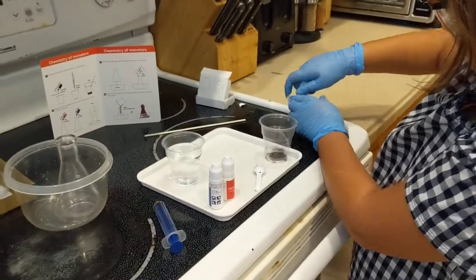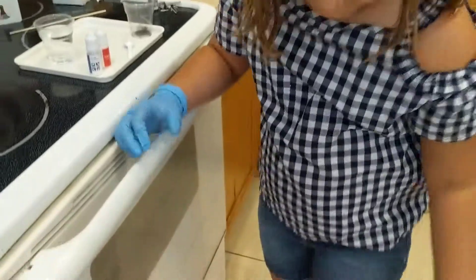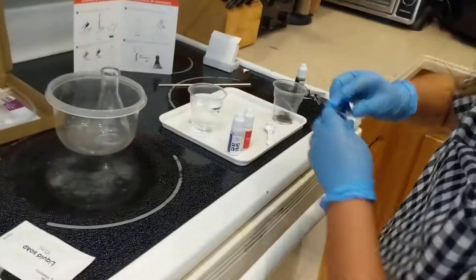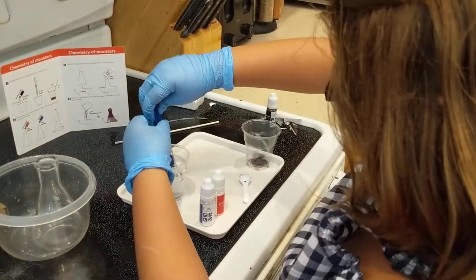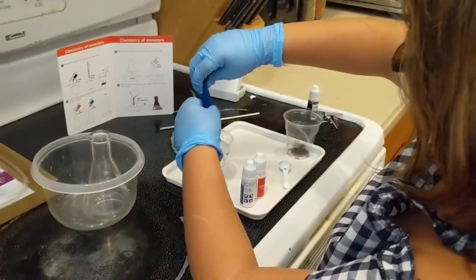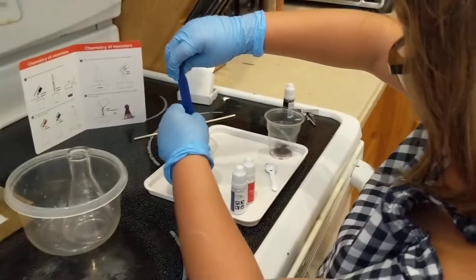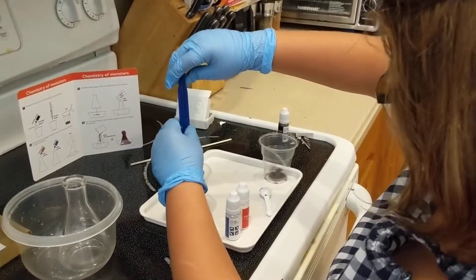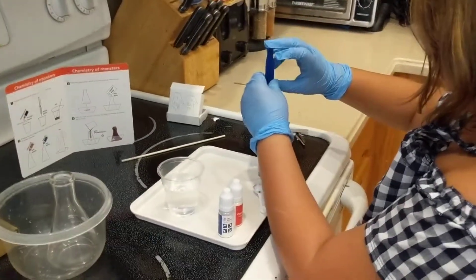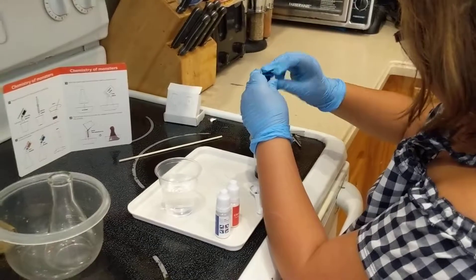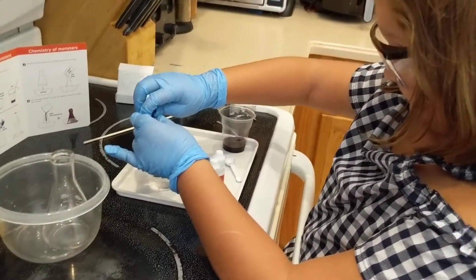Twenty milliliters of the water. So there's the water for you, remember just up to the... that holds 10 milliliters, so how many times you got to do that? Twice, good job.